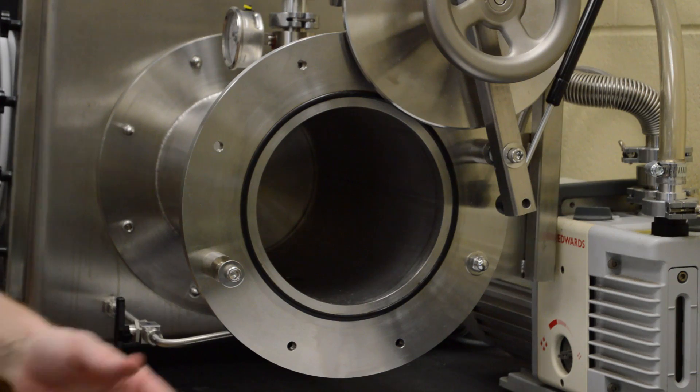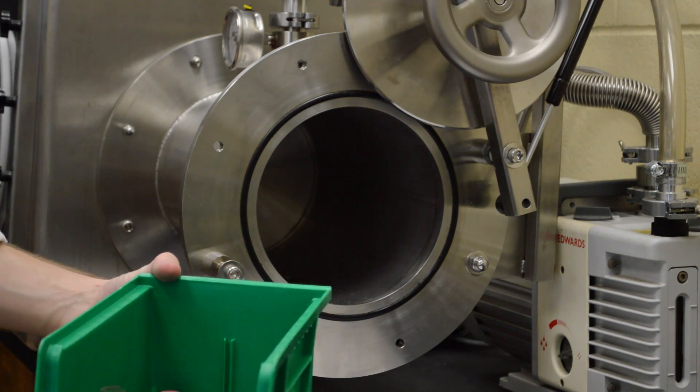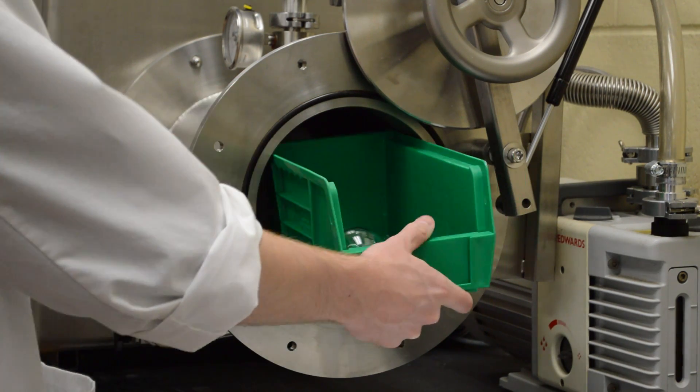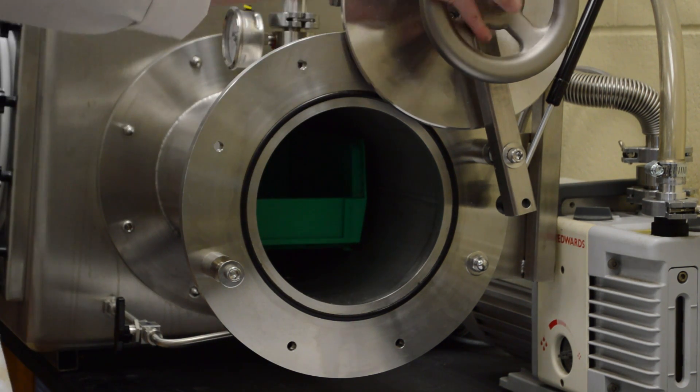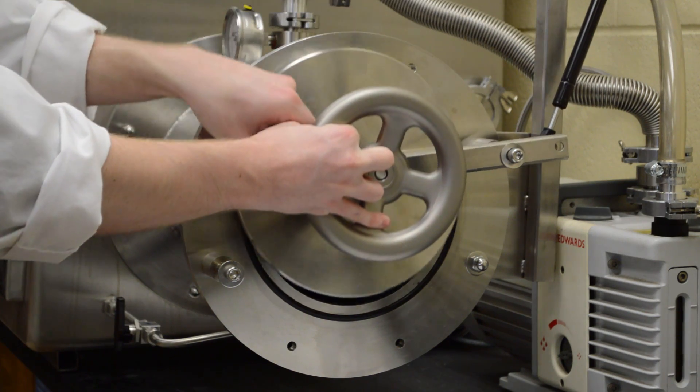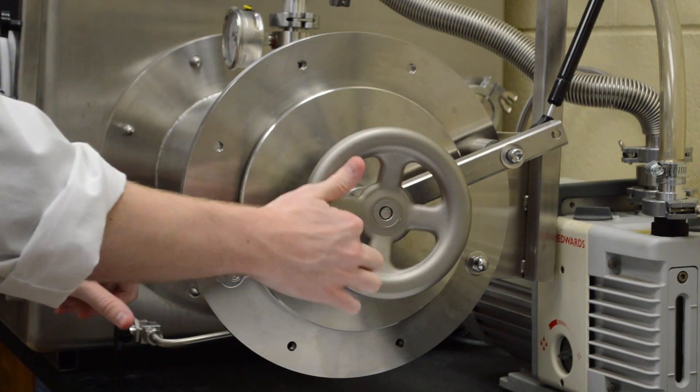When putting anything in the glove box, you want to make sure that you have all your materials in this one box. You want to make sure you push these way to the back, because when you're inside the glove box, the gloves are a little restricted. It's going to be a lot easier to grab it.